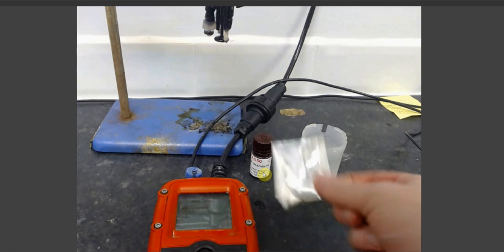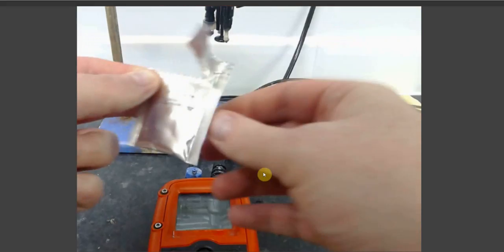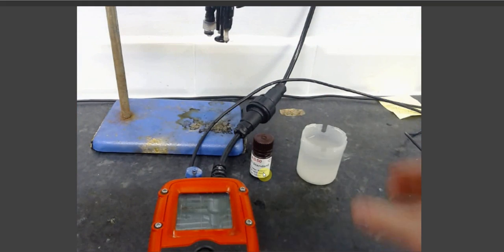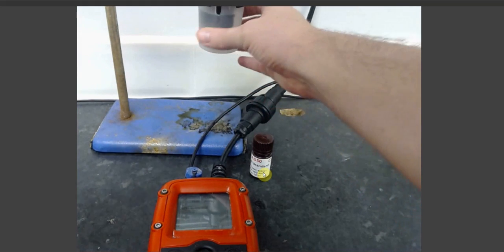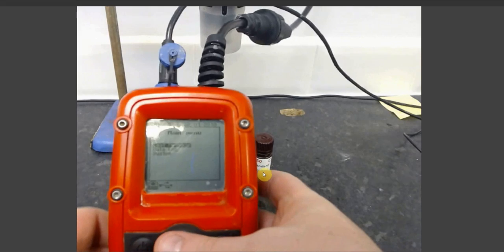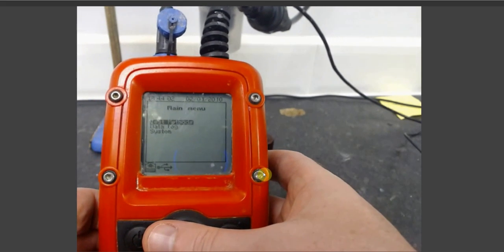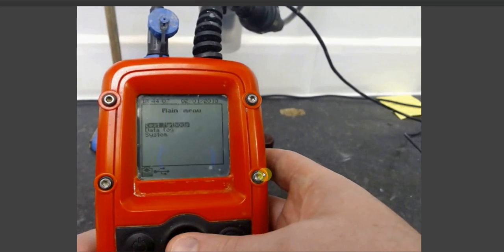To begin, take your HM3 buffer and add it to your sample water. Once this is done, attach your sample analysis beaker to the sonde. Once attached, take your Metalyser unit. You will be presented with the main menu, which contains your test methods, data log, and system options.